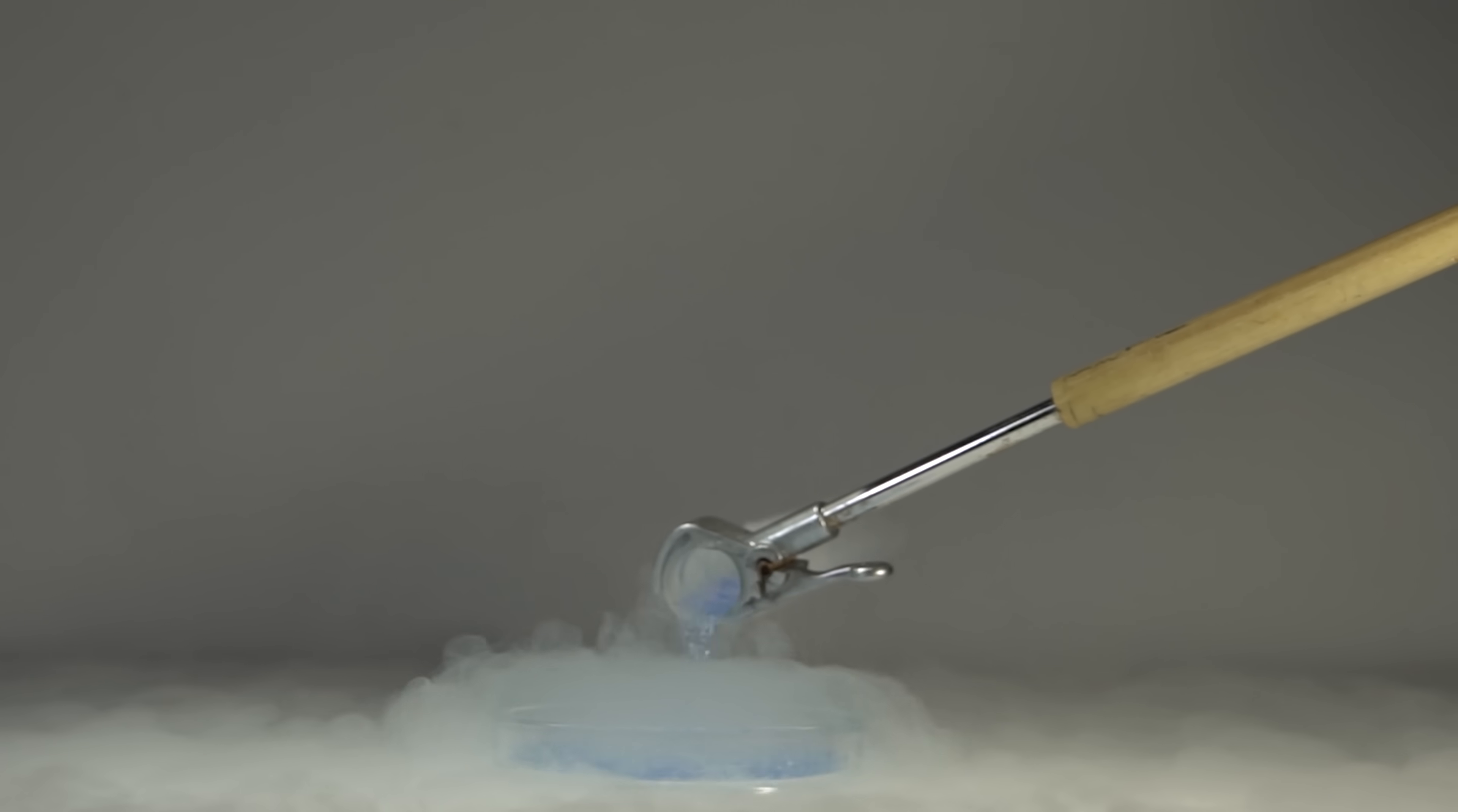To slow down the evaporation of ozone, I've added some liquid nitrogen to the dish beforehand, which also helps delay the immediate explosion of the acetylene.